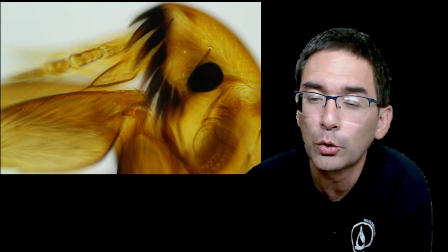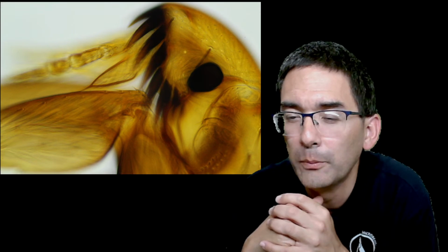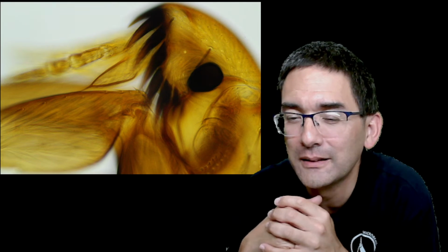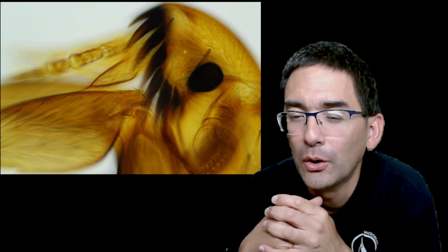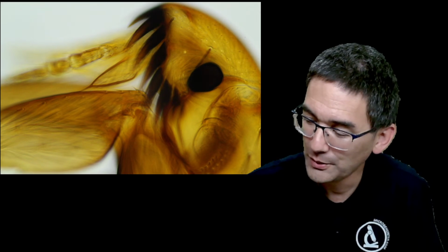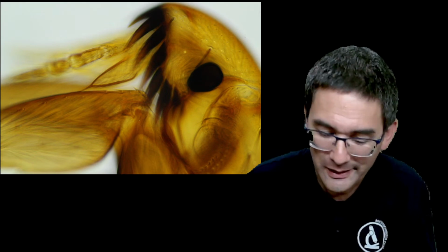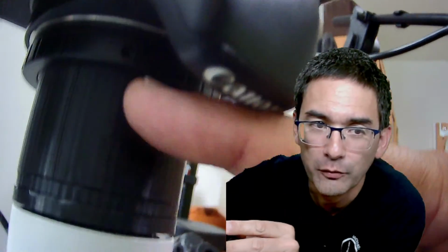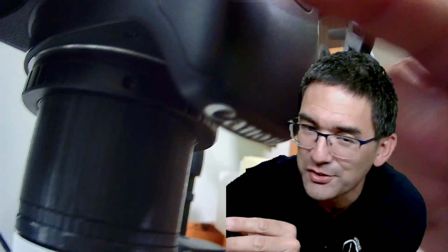So I see a few more comments here already. How do you calculate the distance from the lens to the scope to the sensor? How do you suppose the light has to be at a specific angle, distance? Essentially, I'll be very honest with you. The question is, in other words, how long should this tube be to the sensor?